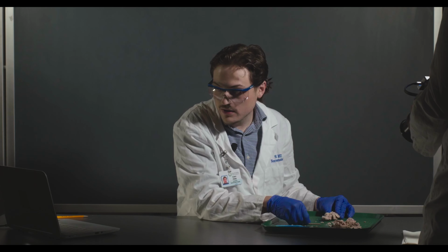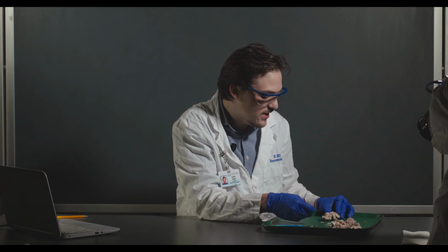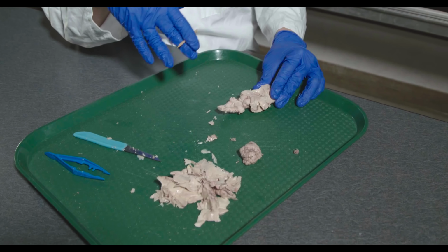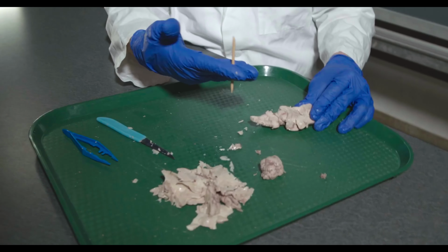Okay, so that concludes the sheep brain dissection for the thalamus, basal ganglia, and so forth. So review everything that's in your lab manual, go through the structures. We will give you the exact pictures that are in the lab manual, not what was shown here, so that you can study that and essentially get prepared for the lab quiz or the lab practicum.